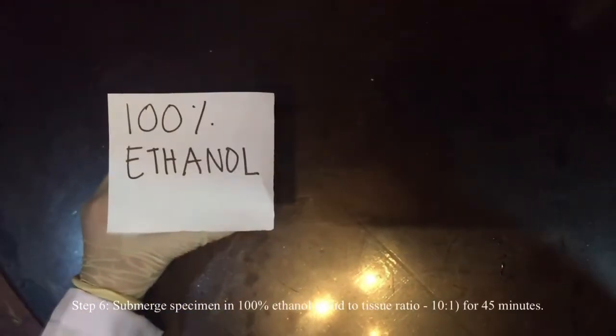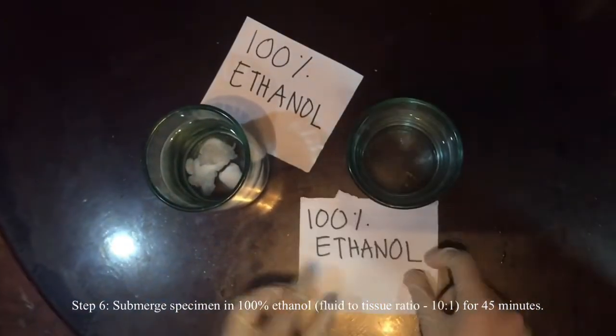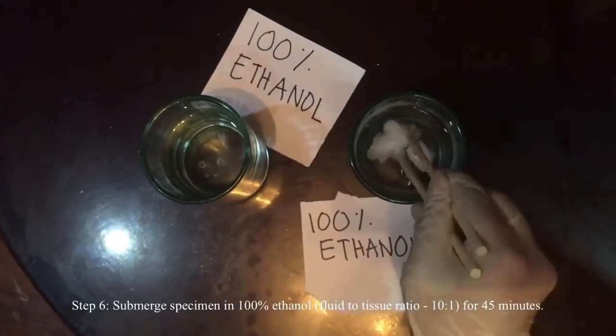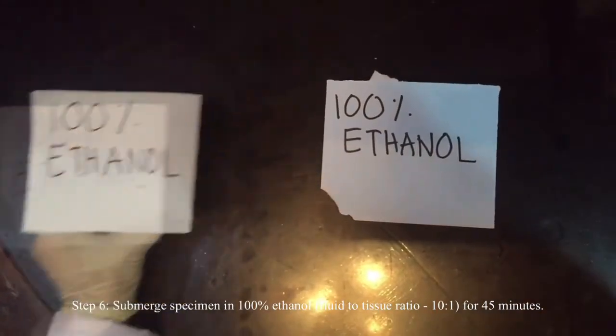So after waiting 30 minutes, we are now going to proceed to our last and sixth step, which is the fourth 100% ethanol change. Now we're going to change it into 100% ethanol again, and we submerge it this time for 45 minutes.